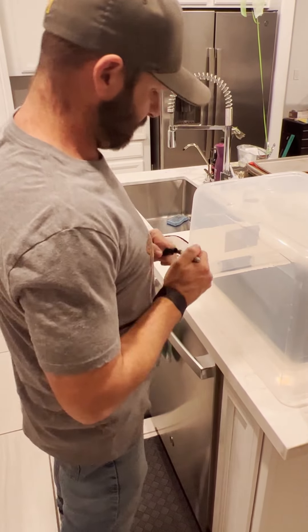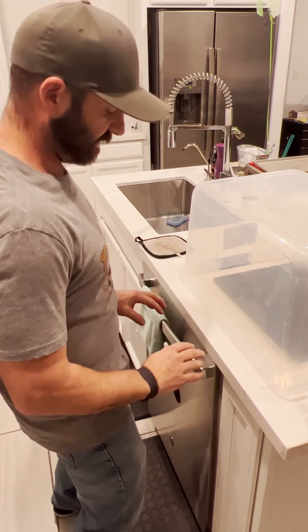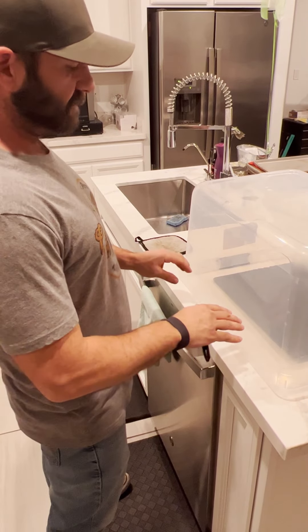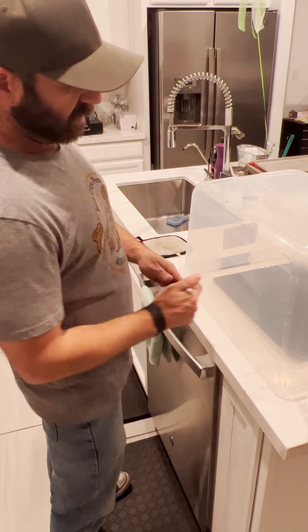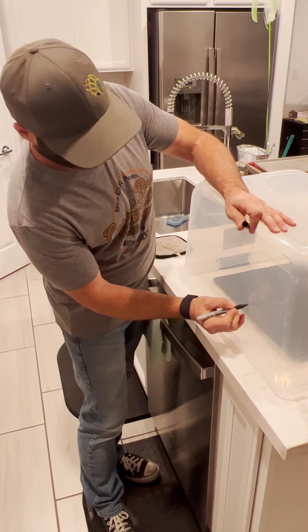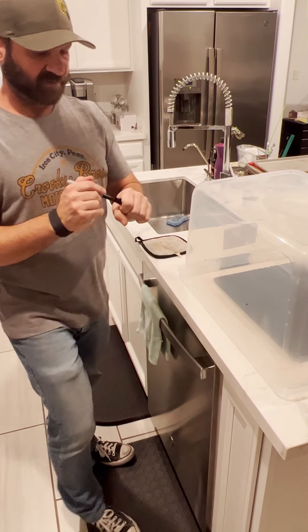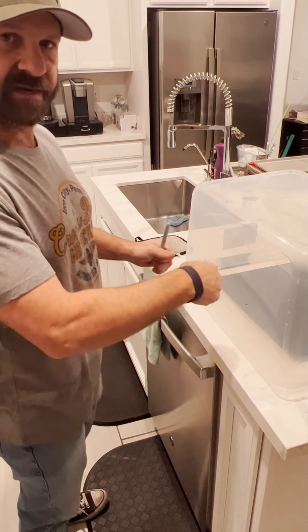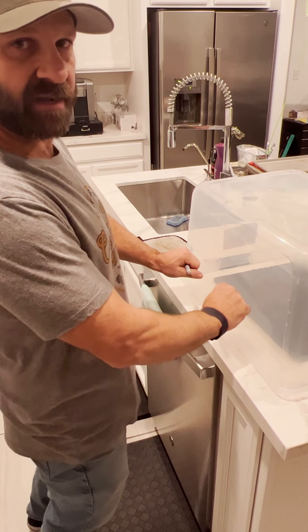While we're waiting for that to heat up, you want to get an idea of where the holes are going to sit when you normally work in it. If you're going to be standing up or sitting down, actually get into that position and see where your hands feel comfortable. For me, I'll usually be standing up, so I'm just going to put a mark about here and about here. It doesn't have to be perfect, but make sure your hands aren't way up too high or way down too low.